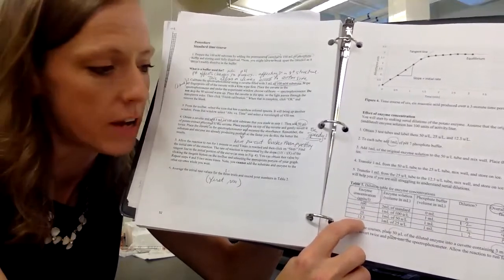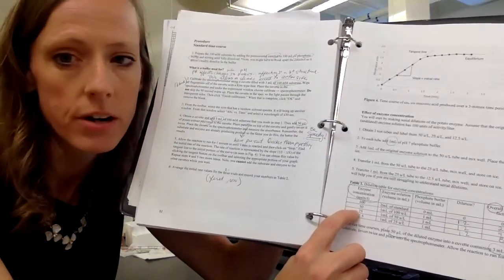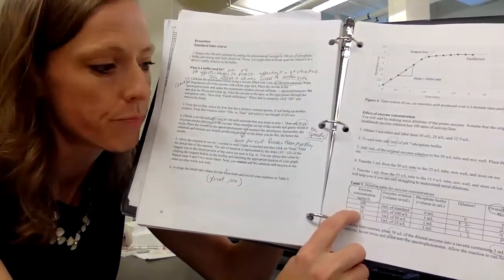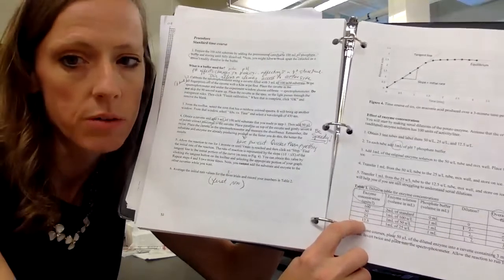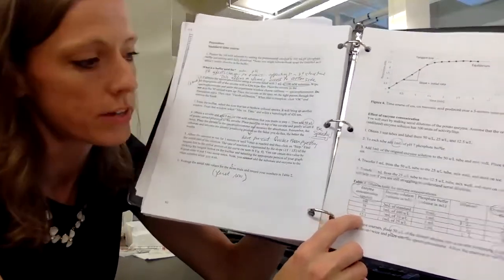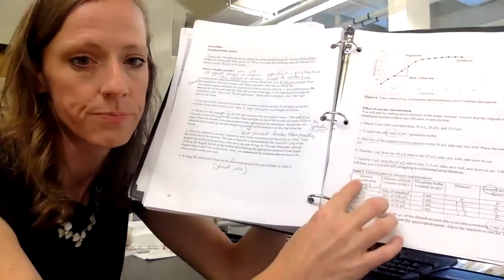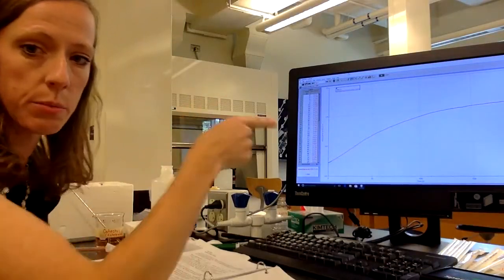And we do that one more time. Again, it's just serial dilution. We go into the 25 unit per liter, take 1 ml of that, and we mix it with 1 milliliter of phosphate buffer to get the 12.5 unit per liter concentration. Okay, so that's how we make our dilutions then. And then when we do that, we repeat this process, okay, that we just did.